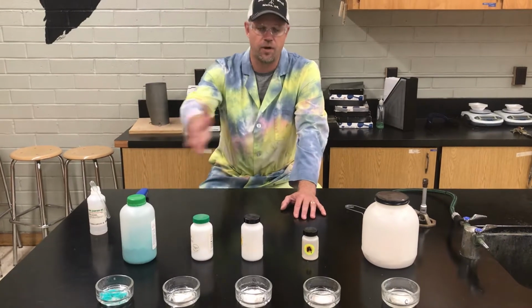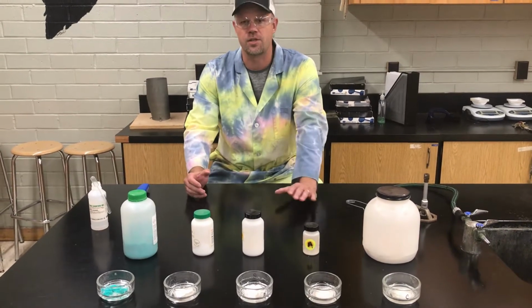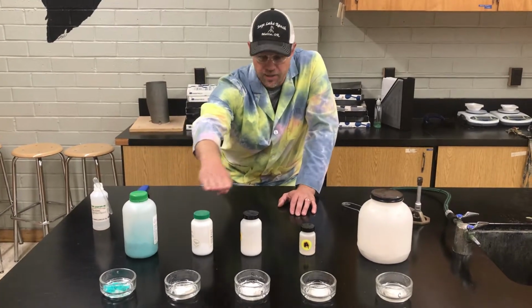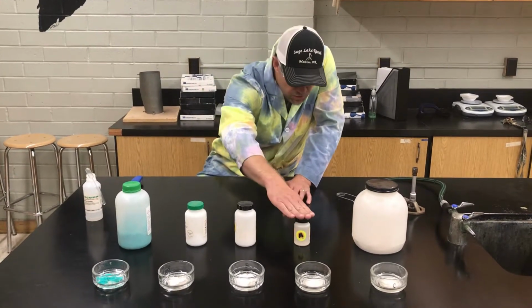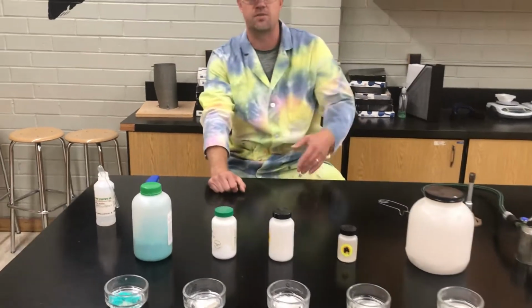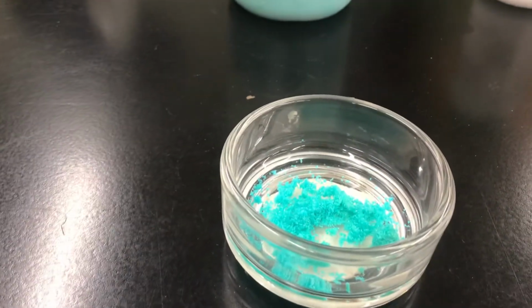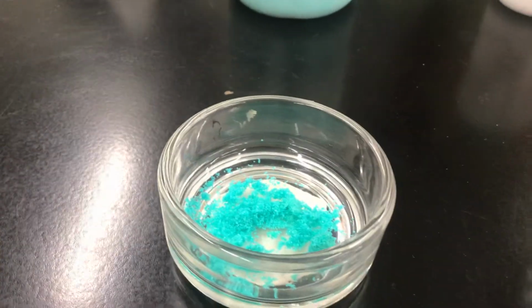So what you've got in front of you here is 5 salts, and these salts have different metals in them. This one here has copper in it, this has lithium, this has strontium, sodium, and potassium. And the reason I picked these 5 is they're ones that we can detect the different amounts of energy just with the naked eye. Now as you take a look at these, you'll notice that the copper salt definitely has a bluish green color to it.